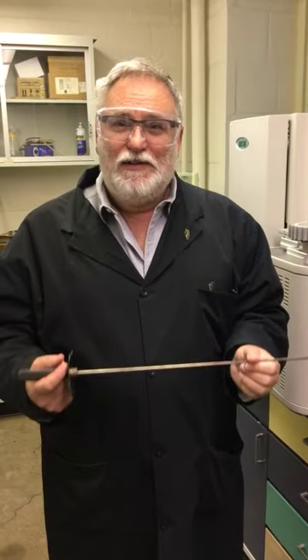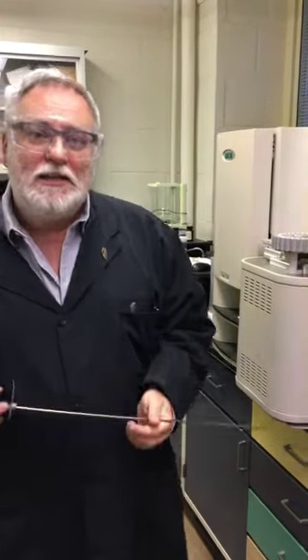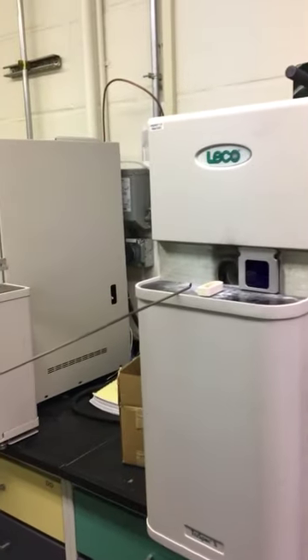Right now it's cold, and so it's just a small tweak in temperature. It's operated, I think, at 1,350 degrees Celsius. Again, you should check that in the ASTM. So once the computer tells me it's okay to add the sample, we will slide the door open. If it was on, it would be so bright I can't look into it.